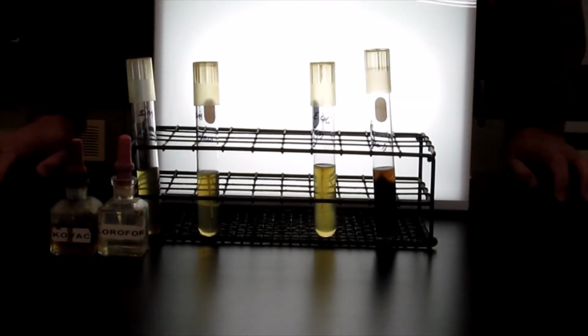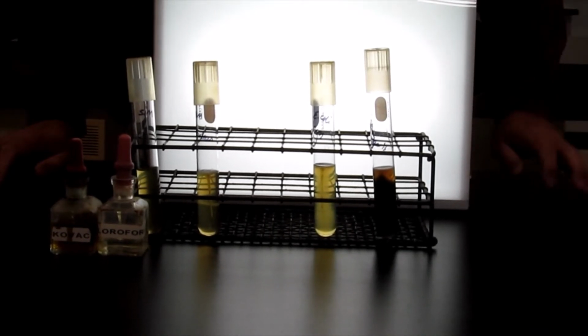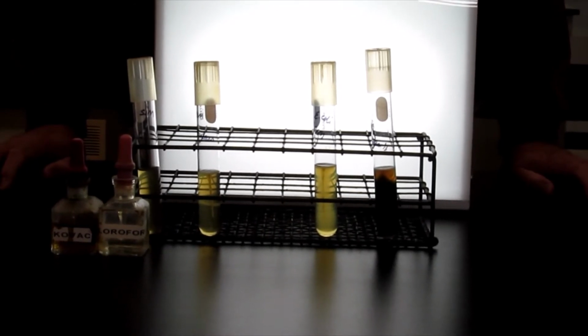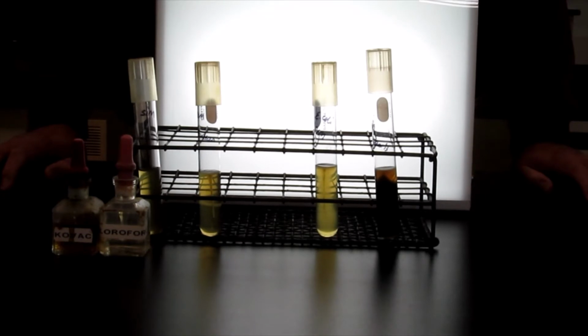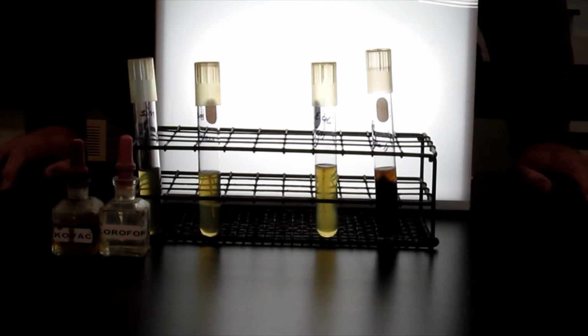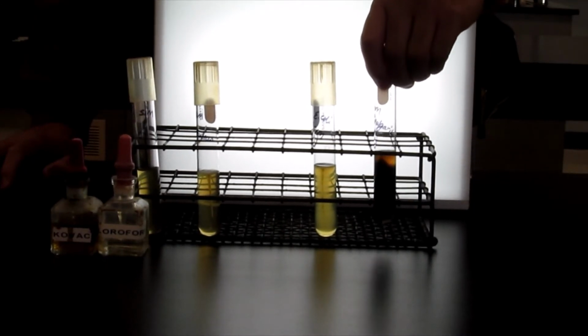So the third phenotype that we're interested in getting from this media about our bacteria is whether the bacteria can produce indole from digestion of the amino acid tryptophan that's present in the media. So we talked about casein digested peptone and animal tissue digested proteins being present in this media, so that would be a source of the tryptophan.